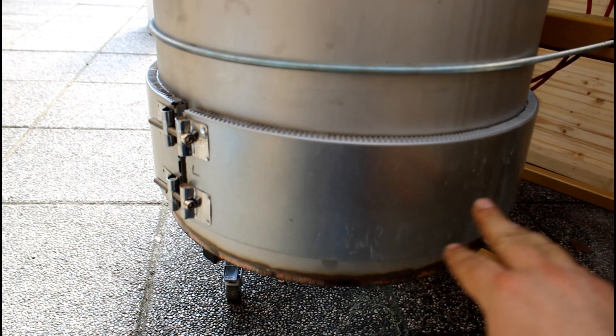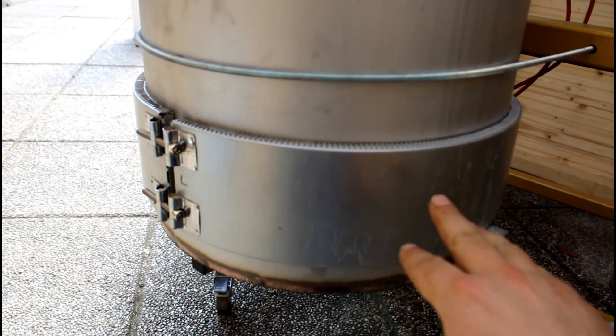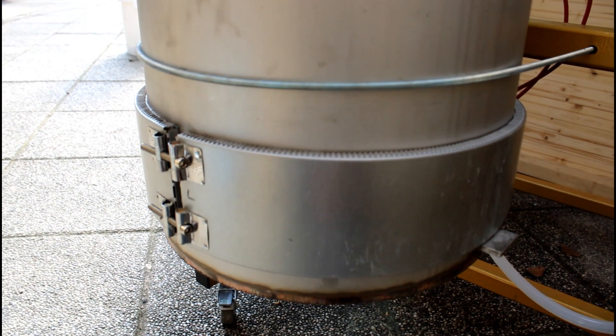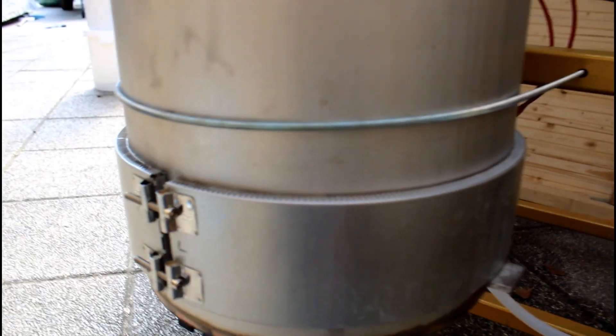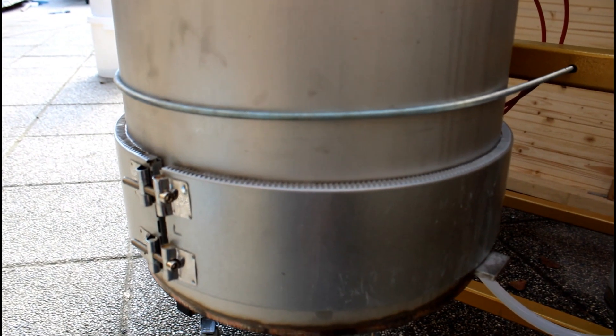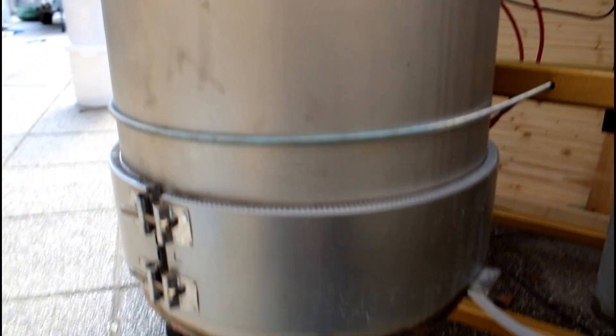And here is a close up of the heating mantle. It has some ceramic elements and some heating wire inside. And as I told it heats with about 6 kilowatts and brings the solvent to boil actually very fast.